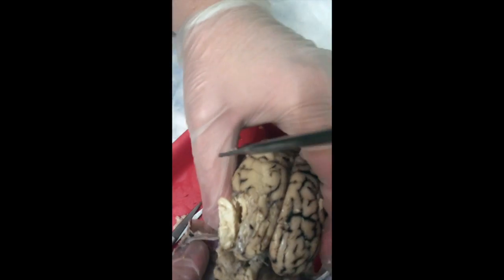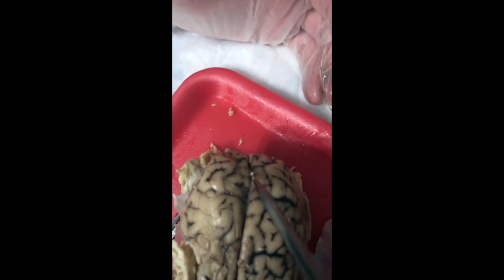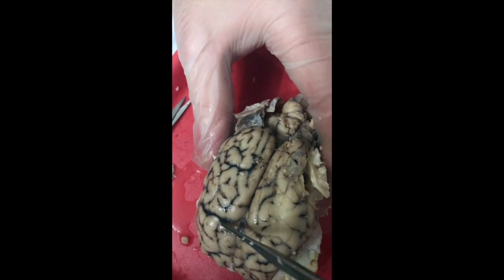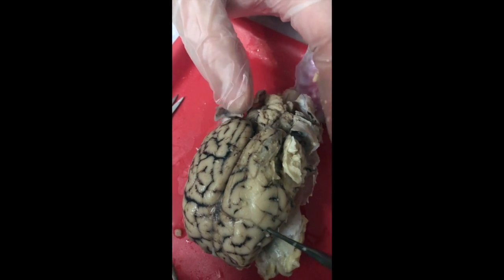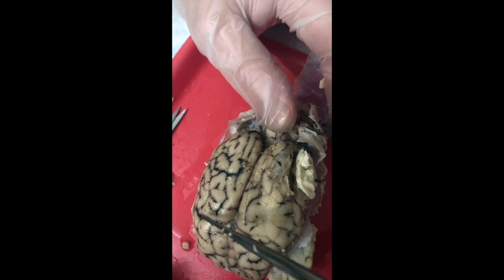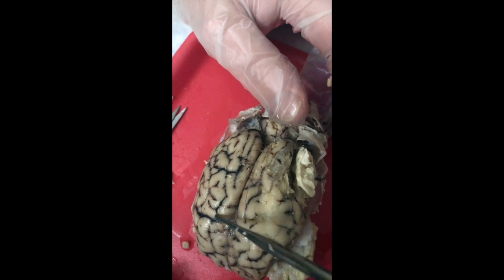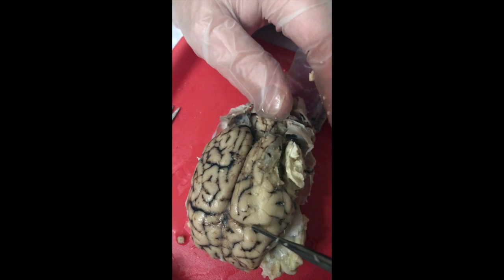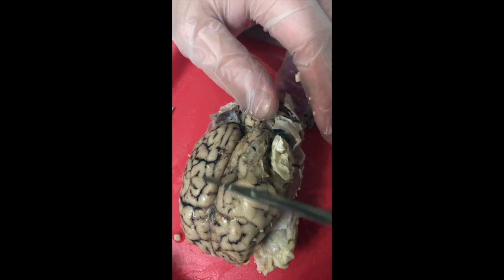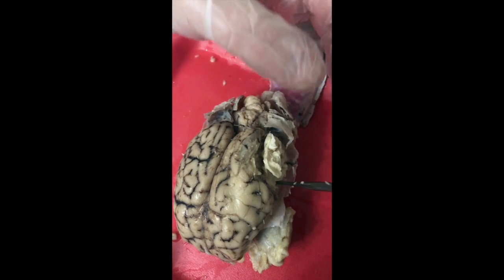So you're looking at your right and left cerebral hemispheres with the longitudinal fissure running down the center. If you look at the top of the anterior surface, you can see this line running transversely across the longitudinal fissure, equal on both sides. That is going to be your central sulcus, right and left. So on either side of that, you're going to have your precentral gyrus and your postcentral gyrus. Remember, the central sulcus is the separation between motor controls in the frontal lobe and sensory controls in the parietal, occipital, and temporal lobes.